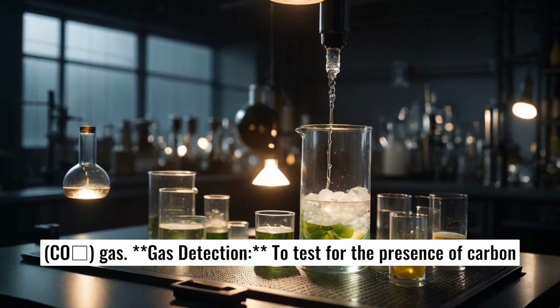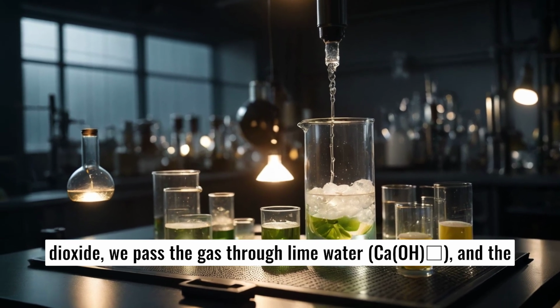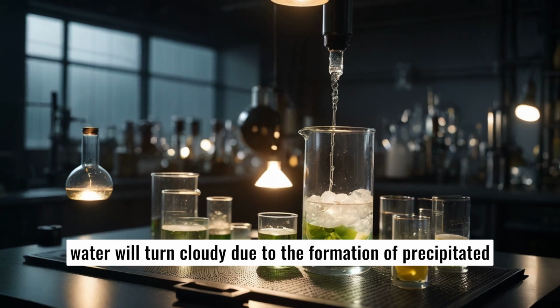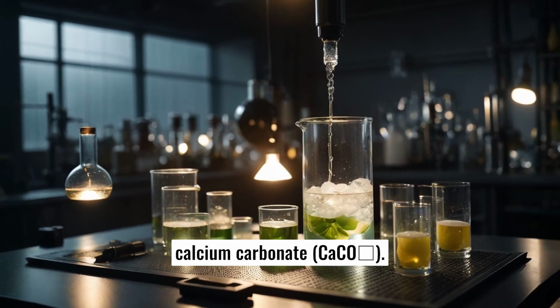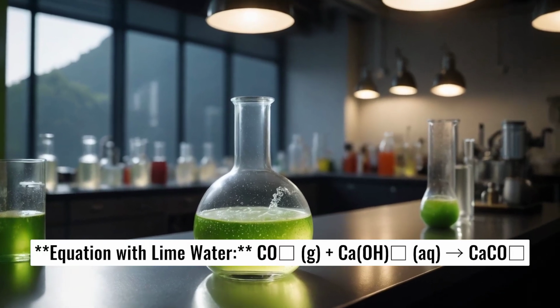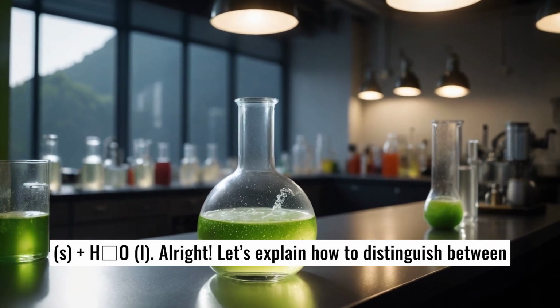Gas detection to test for the presence of carbon dioxide. We pass the gas through limewater, Ca(OH)2, and the water will turn cloudy due to the formation of precipitated calcium carbonate, CaCO3. Equation with limewater: CO2(g) + Ca(OH)2(aq) → CaCO3(s) + H2O(l).